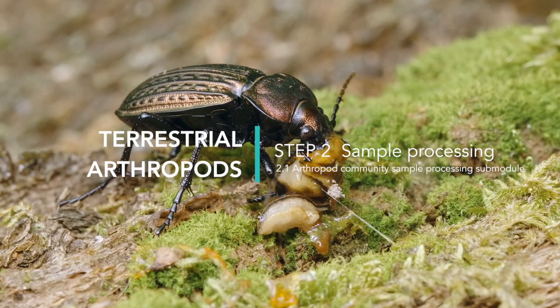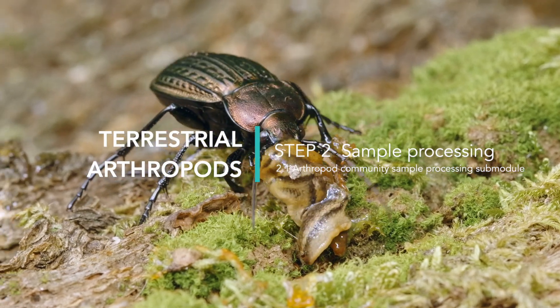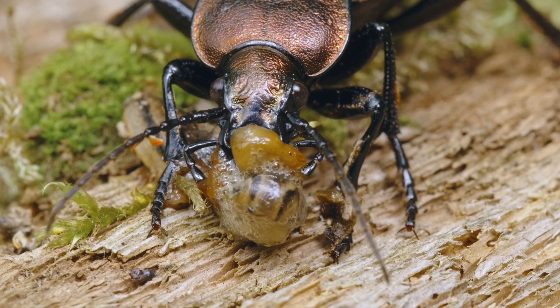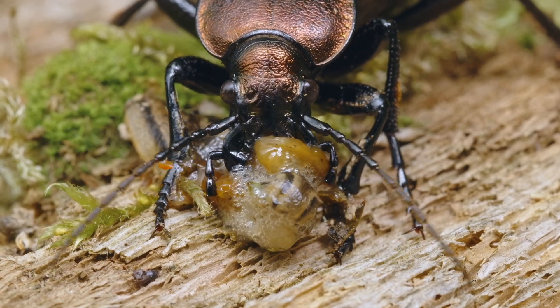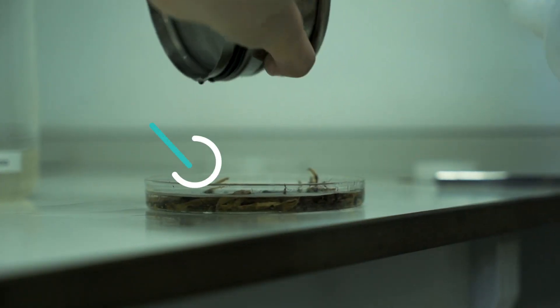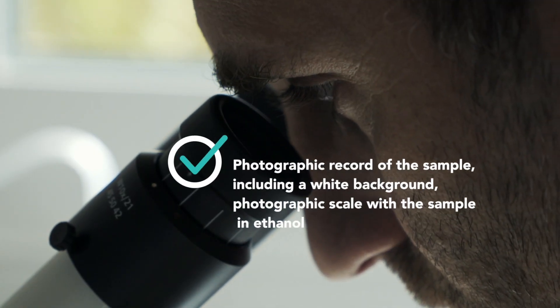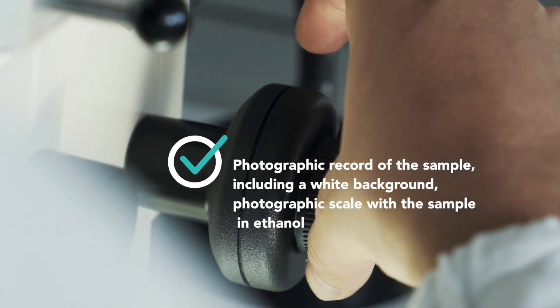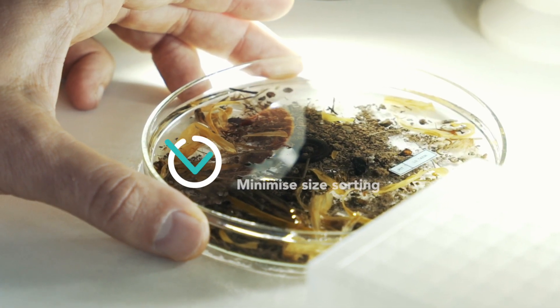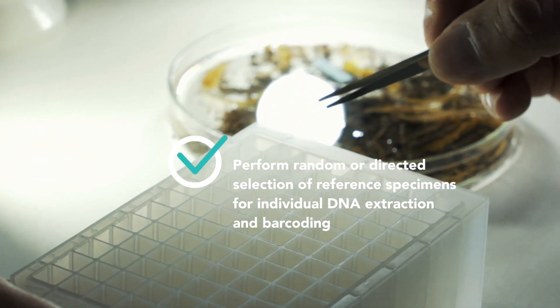Step 2: Sample processing. Arthropod community sample processing sub-module. We propose a minimum set of procedures to be undertaken for arthropod samples prior to DNA extraction, with the following guidelines and recommendations: measure sample wet mass weight using 2-μm nylon filtration fabric; photographic record of the sample including a white background; photographic scale with the sample submerged in ethanol; minimize size sorting; and perform random or directed selection of reference specimens for individual DNA extraction and barcoding.